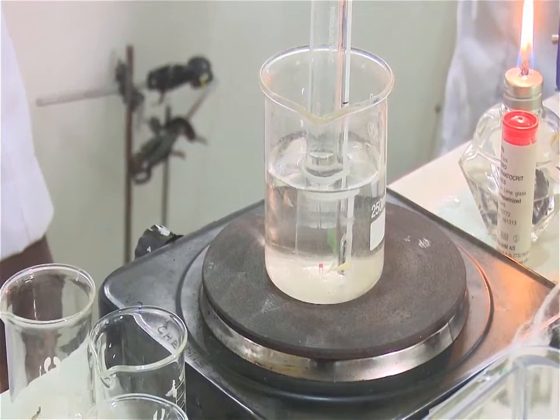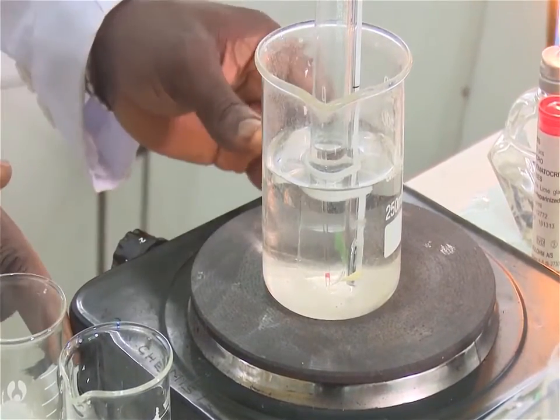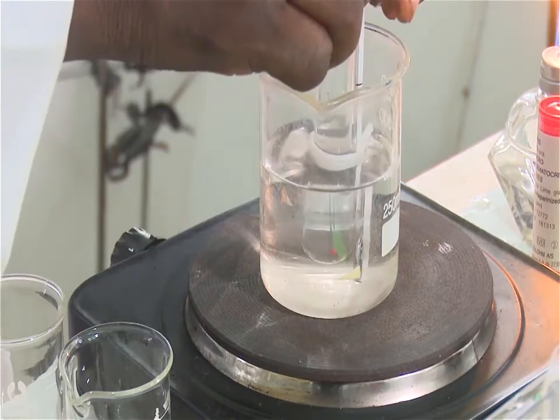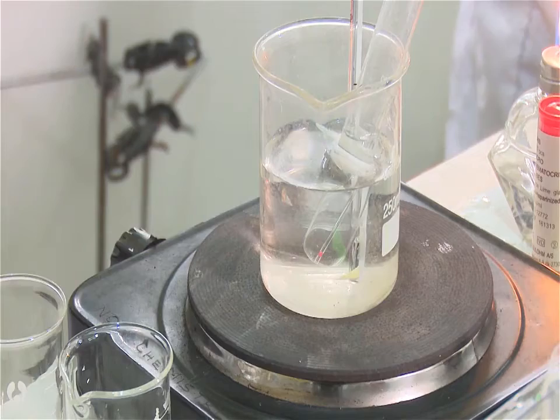Remove the heat, but do not take the assembly out of the water bath or oil bath, and carefully watch the capillary. Bubbles continue to be seen until the pressure exerted by the vapor of the liquid becomes equal to the atmospheric pressure.